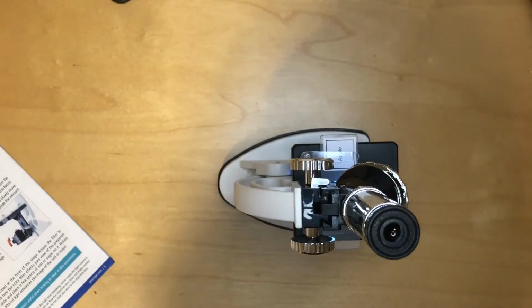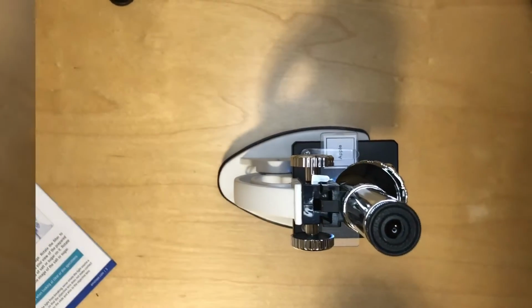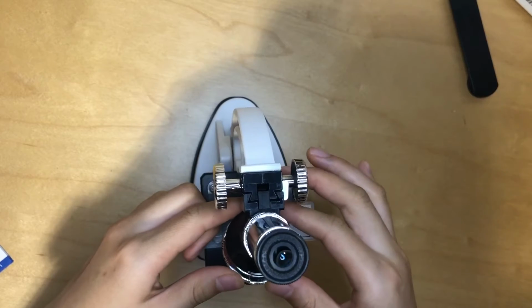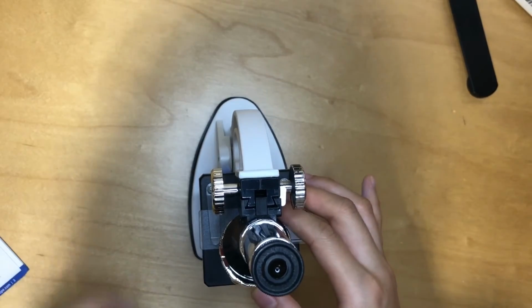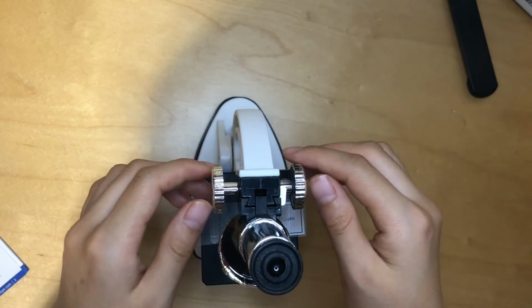Now let's see. They always recommend us to start with the lowest magnification, so that will be 15 times bigger. So right now the microscope has 15x magnification, and let's see what's under there. It can be a pain trying to find those things first of all. So now we have to turn this part, which is called the knob, and let's see. Now you put the slide into focus and let's try to adjust. Oh, it can be such a pain to adjust.